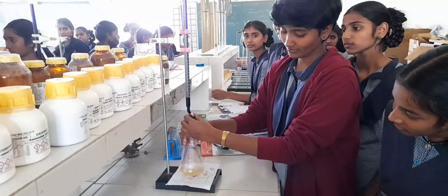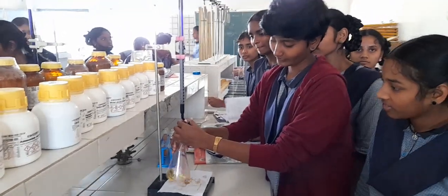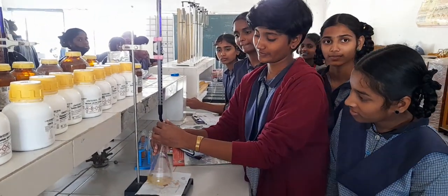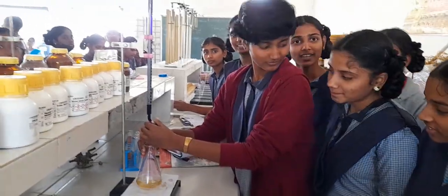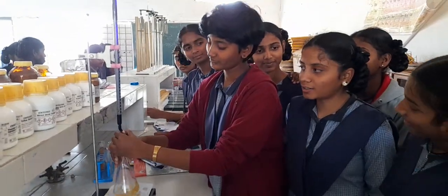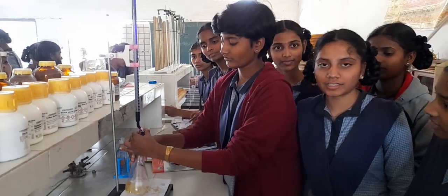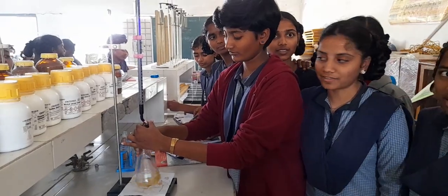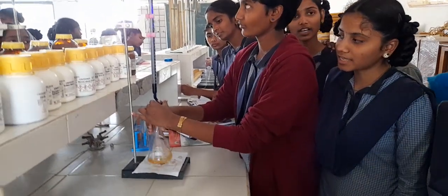Okay, right. We have one more group over here with the same practical. So let's speak to them. Yes, Sophie? Danya? What is your practical about today? Today we are here to estimate the amount of potassium permanganate solution versus ferrous ammonium sulfate. Previously it was oxalic acid. Now you are doing it for ferrous ammonium sulfate.